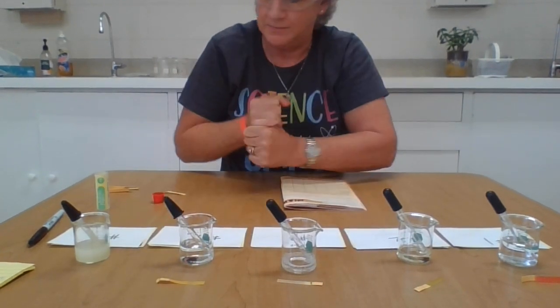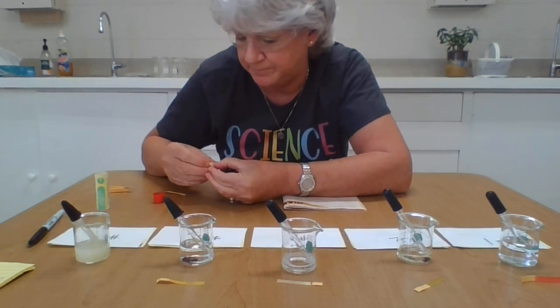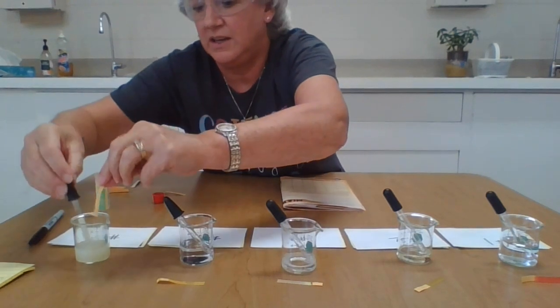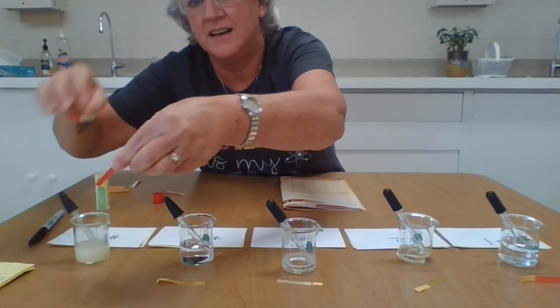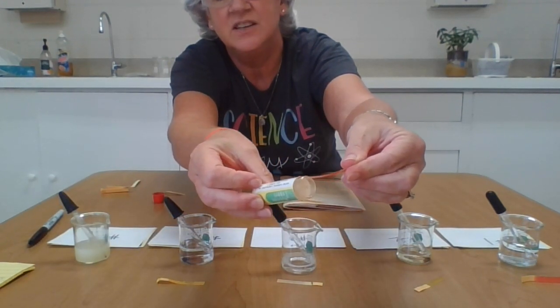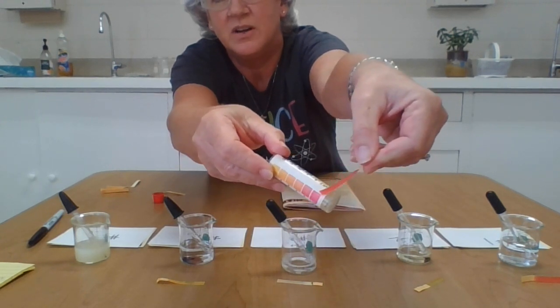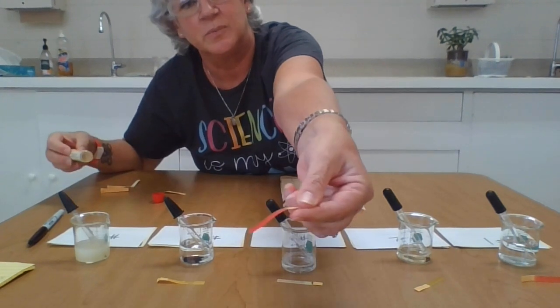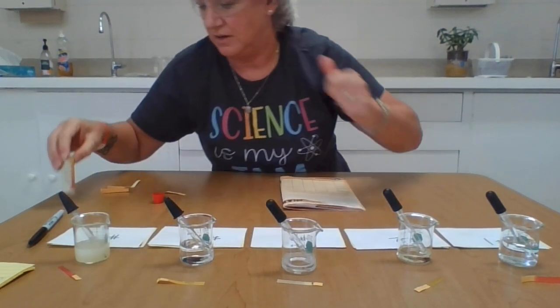And then my last substance, this one that has definitely the yellow color to it. Let me go ahead. Wow, look at that. It immediately turned, look at that, pH of 1. That's a perfect match. I hope you guys can see that on camera. Okay, so pH 1, it turned bright red, pink. Perfect match to number 1.